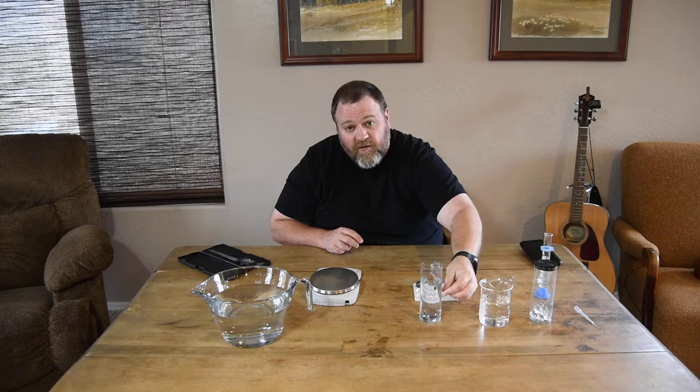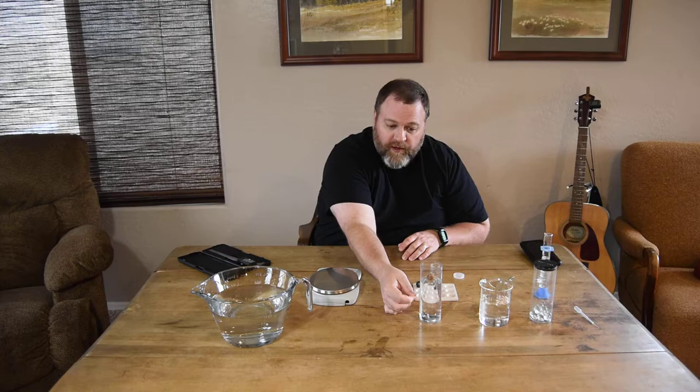Because the steel has a higher density than the water, it sinks to the bottom. But what would happen if an object placed in the water had the exact same density as the water itself? Would it float? Would it sink? Or would it do something else? The answer is it would do something else — it would stay what we refer to as neutrally buoyant. If you lowered it down and let go, it wouldn't float back up to the top and it wouldn't sink down lower; it would actually just sit there.